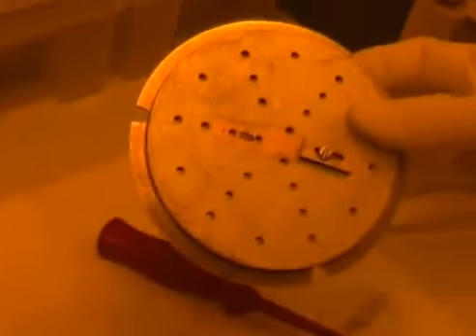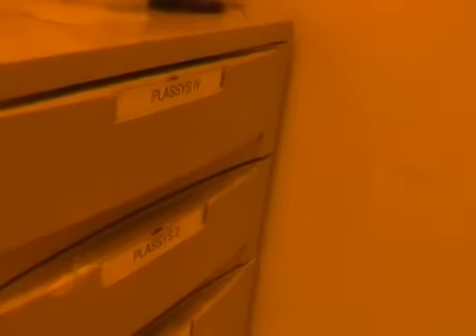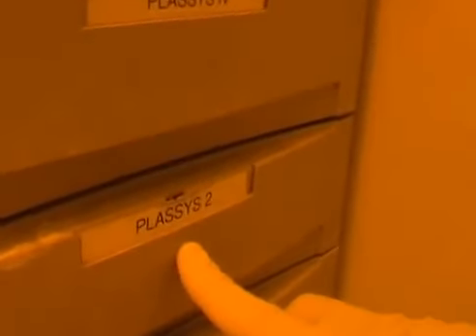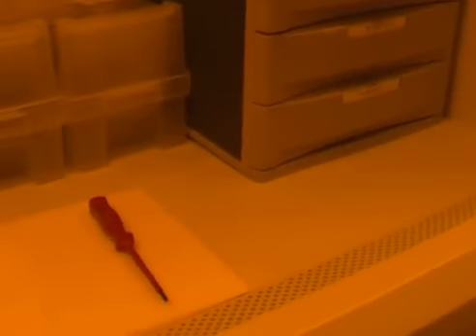Here the clamp is actually tight, so I can put this holder away in the drawer, and I close the drawer, I retrieve my sample. I normally leave the screwdriver here, it belongs to this cabinet and for use of all the different class users, and I make sure in general that everything is nice and tidy. And that is us.